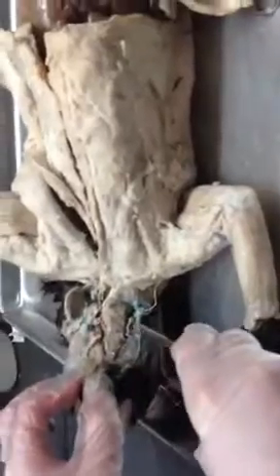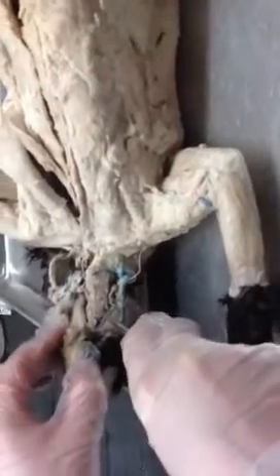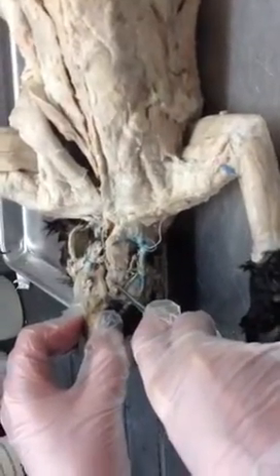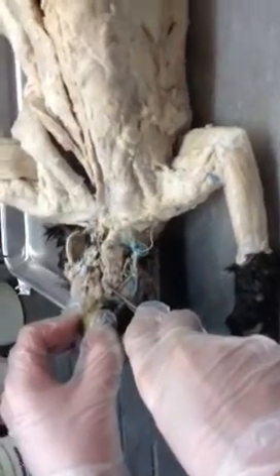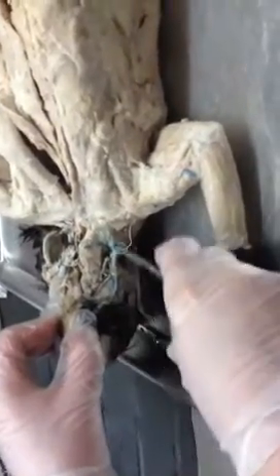The digastric has two heads. And then in between the two heads of the digastric, the sort of triangular-shaped muscle is the mylohyoid. These were all on the midterm, so you just have to identify them. You don't have to know anything else about these.